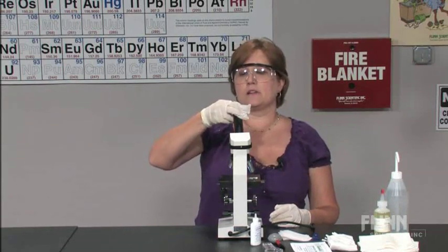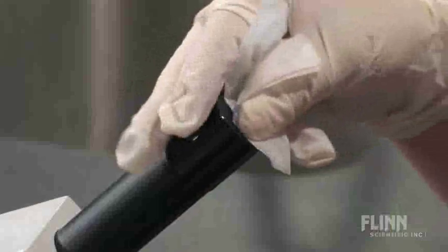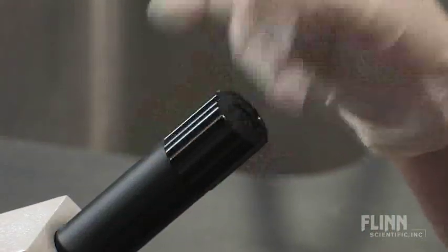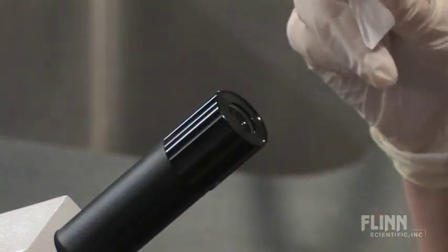After wiping the ocular, you're going to use a clean, dry piece of lens paper to get all the smudges off.